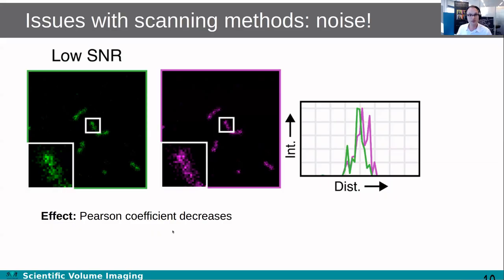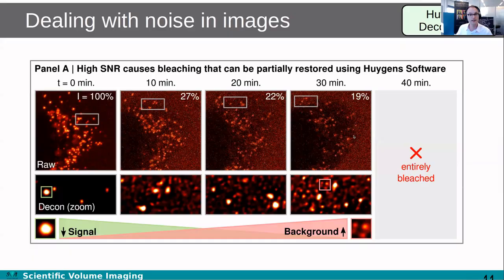Here you see, suppose you have two noise realizations of the same object, but just because it's noisy, they seem to not overlap, but that's just because of the noise. So the noise makes the Pearson coefficient go down. And here we show an example. This is an experiment we did with Lucas Kapitein from Utrecht.